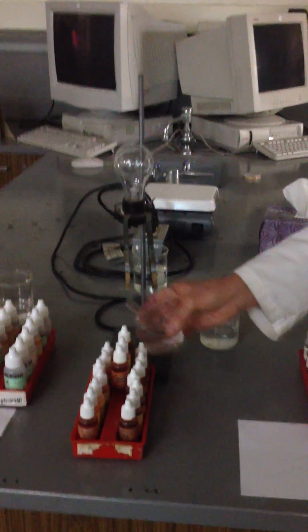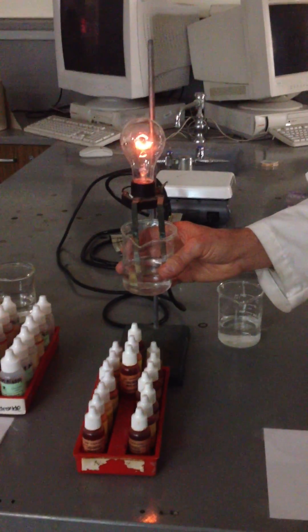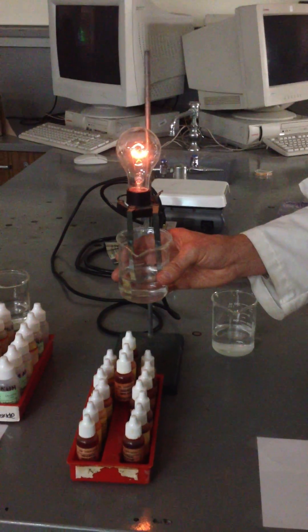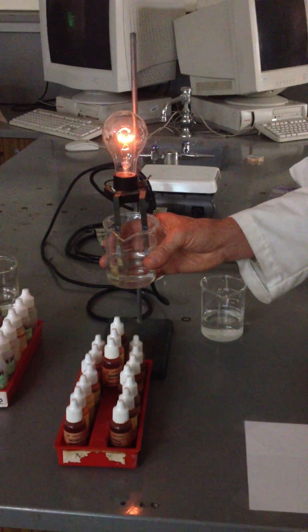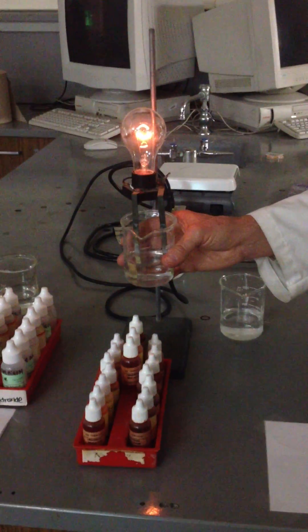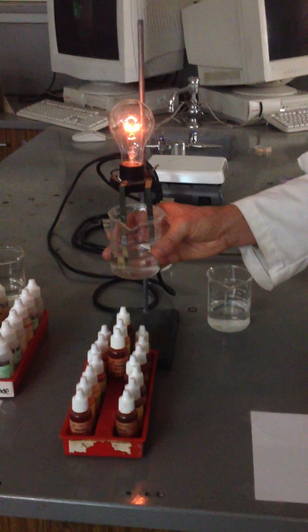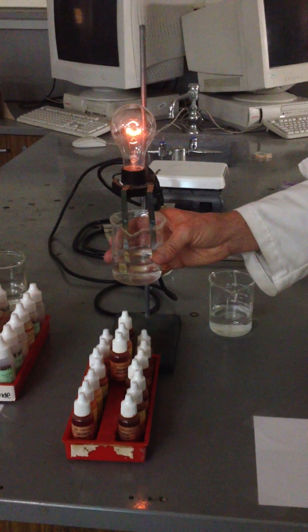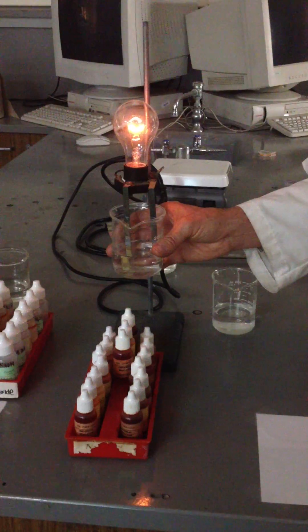And now the ammonia. I already gave that one away. So yes, you're going to see, just like the acetic acid, it doesn't give you a lot of conduction. But it obviously does form ions. And you have everything now for procedure two of the acid-base lab.